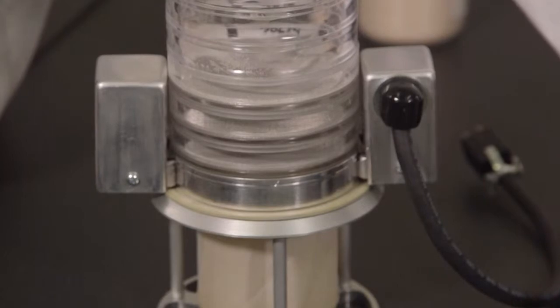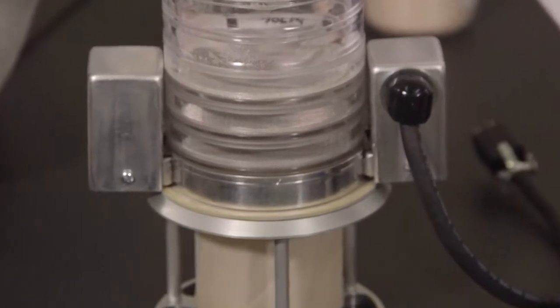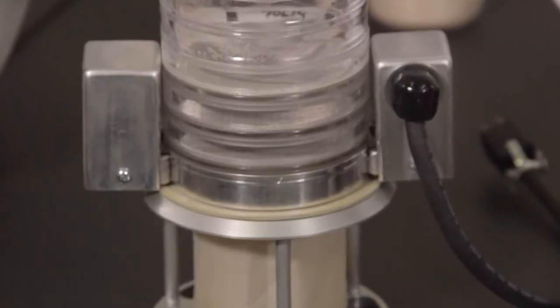For best results, place the ring assembly in the lowest possible position in the test stack, directly on top of the fines collector.